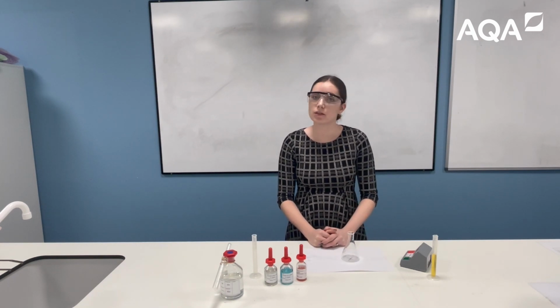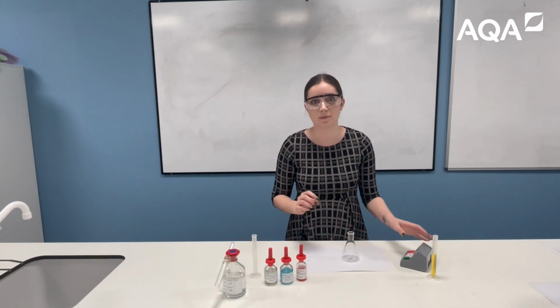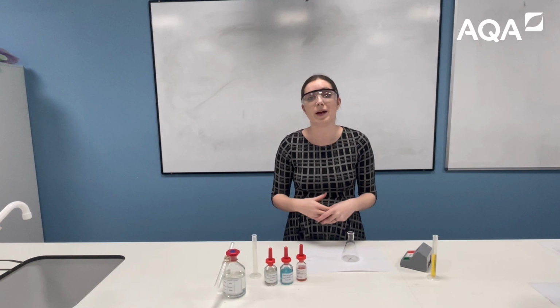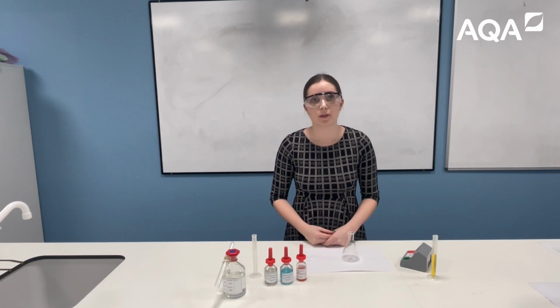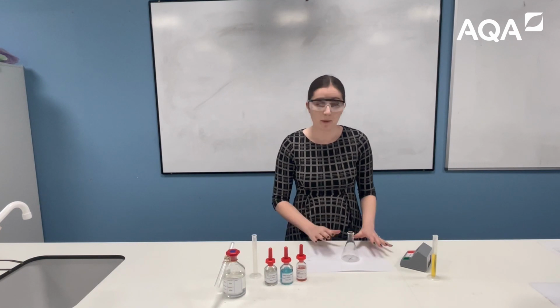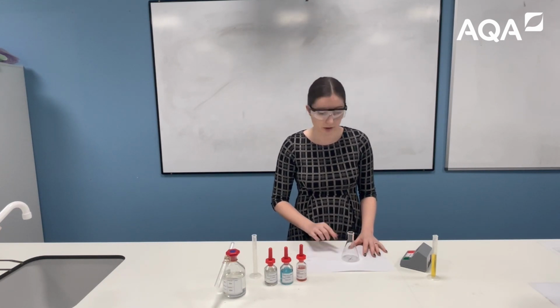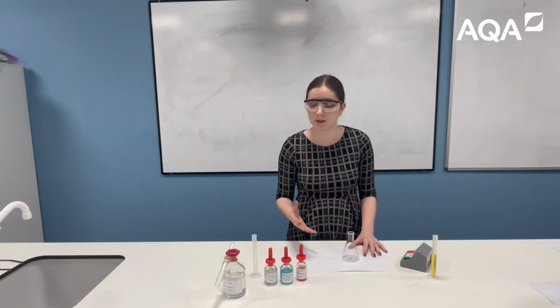And it utilises the reaction between sodium thiosulfate and iron nitrate, which occurs through a deep purple complex. So very similar to the disappearing cross method. However, as the purple complex goes colourless, we will see the cross on a piece of paper appear rather than disappear.